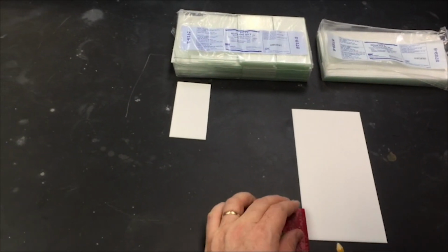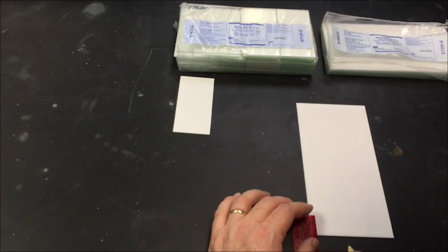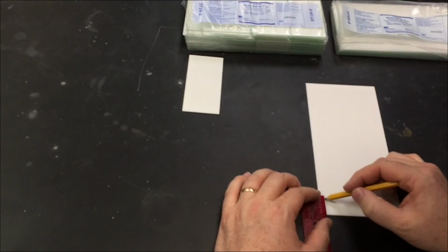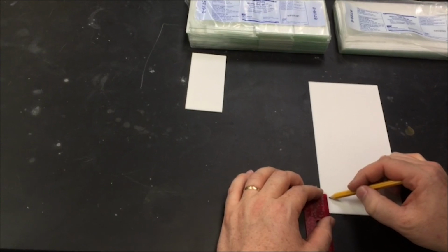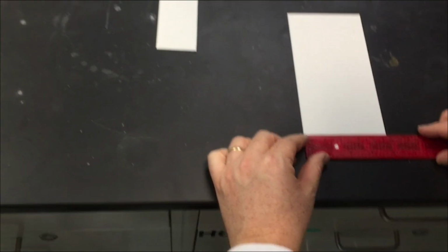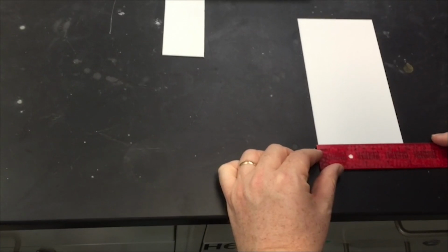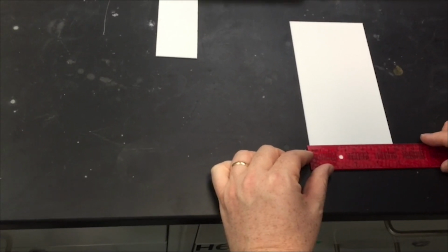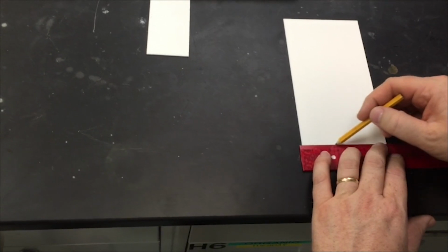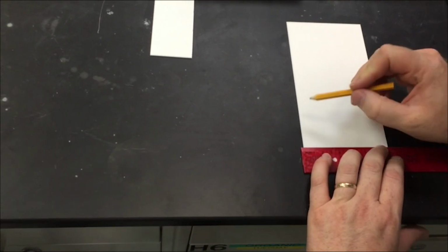Now I'm going to show you a good strategy for marking your origin on a much larger plate. We have these two, and you can use a large chamber for them. You need to mark off your origin at a height that you know is going to be above the solvent level in the chamber. Do it carefully. You're trying to damage the silica as little as possible, and draw your origin line straight across. Again, this needs to be high enough that it does not go into the solvent.